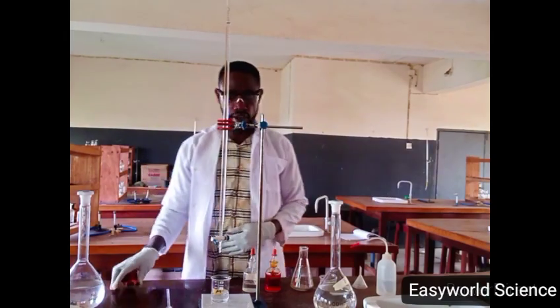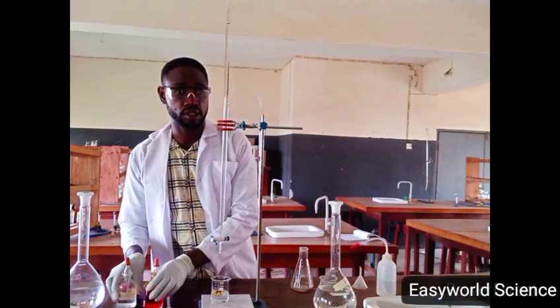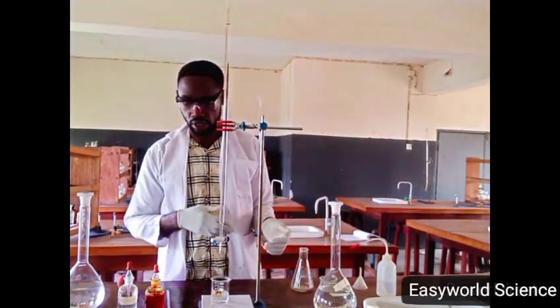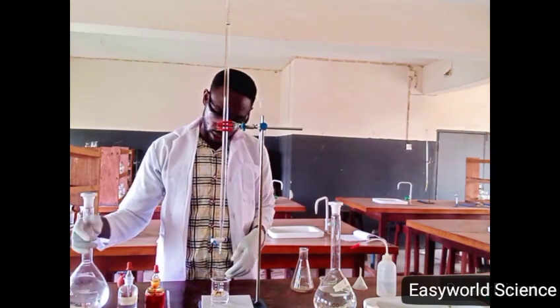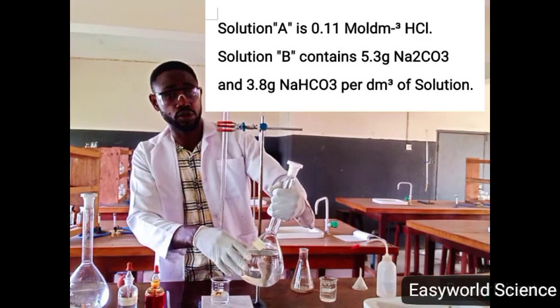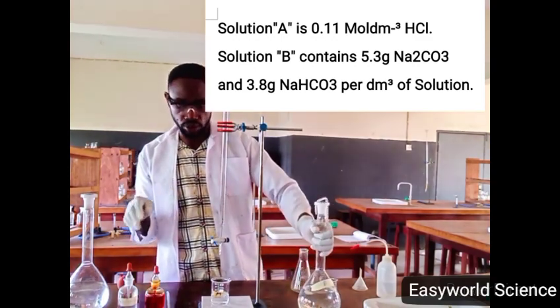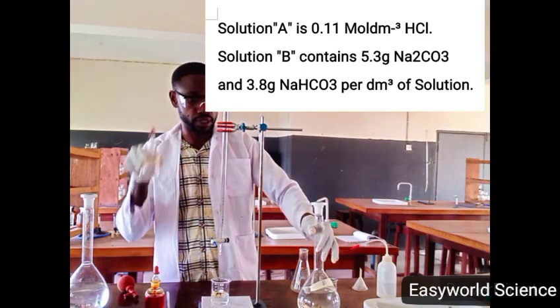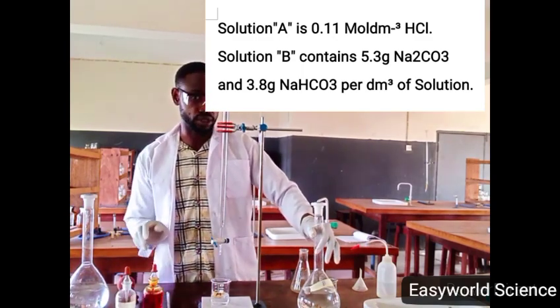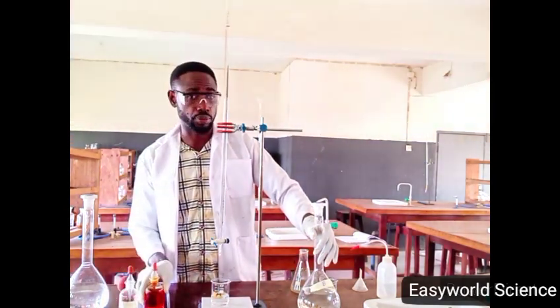Okay, here I'm going to carry out a titration using double indicator. This is the titration between hydrochloric acid and a mixture of sodium carbonate and sodium hydrogen carbonate. Normally, we need to use phenolphthalein indicator first, and then followed by methyl orange. The endpoints for the two are not the same. We have a phenolphthalein endpoint, then the methyl orange endpoint.